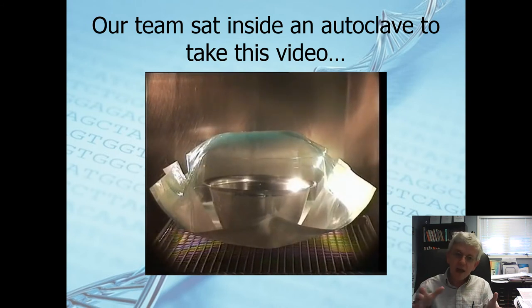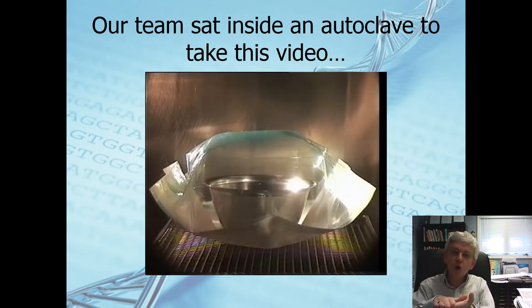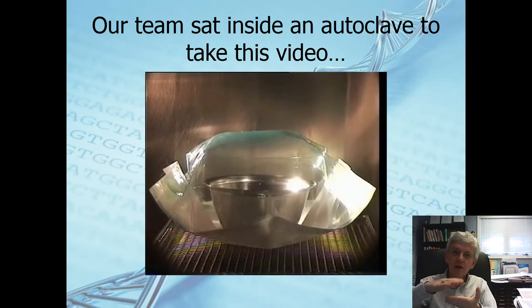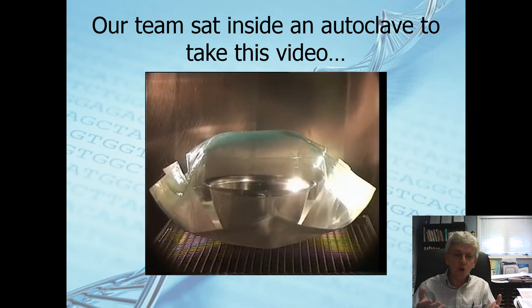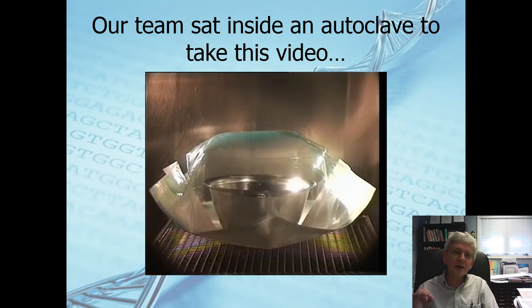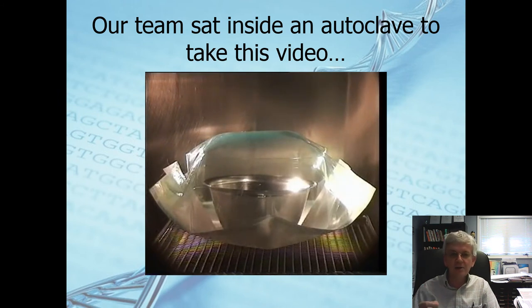You imagine what would be going on now if there were things placed around this. If the lip of that corner of the bag there was on something and it was lifting it up and flipped it over, or it was just piled on top of each other and these things start spreading around. Look at how big this bag is getting. This is incredible to me sitting here watching this video of just the dynamics that go on inside here.